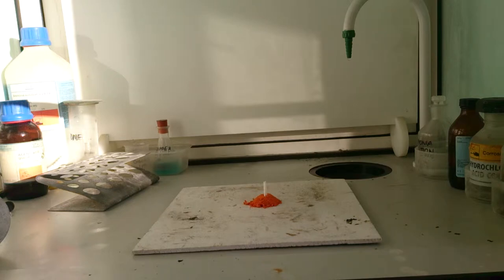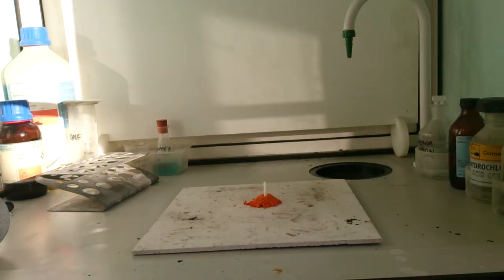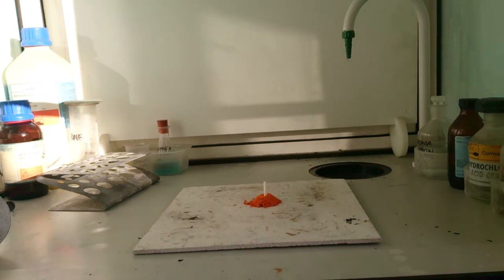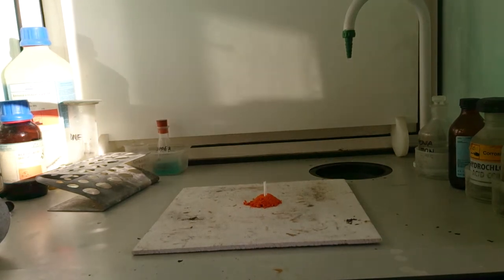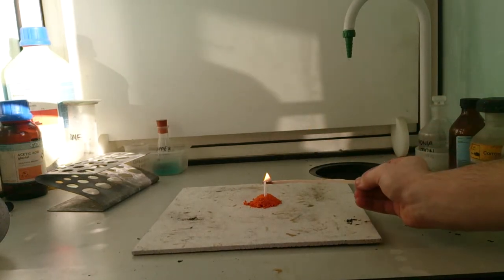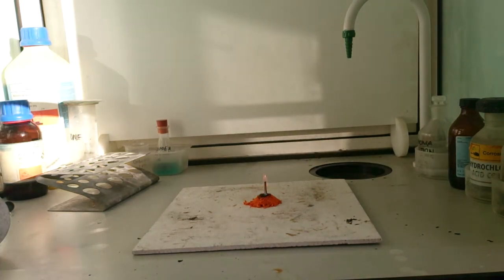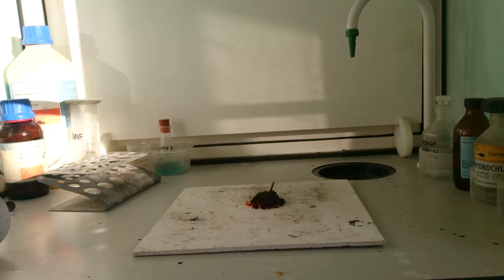So I just had to grab a splint. Basically, when this reaction goes on, you'll see it produces quite a lot of heat and also produces chromium oxide as the ammonia goes off. Now, it's quite a quick reaction and it doesn't need a lot of heat to get it going. So, once it's going, as it's going now, you'll see that quite nicely it almost looks like a little volcano going up. I'm going to put it a bit closer for you.